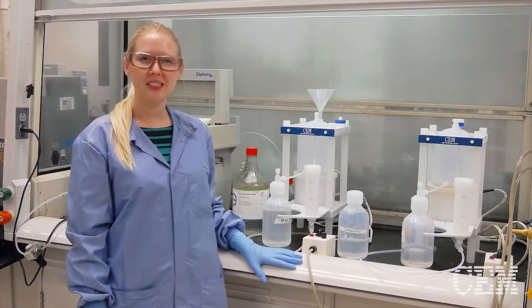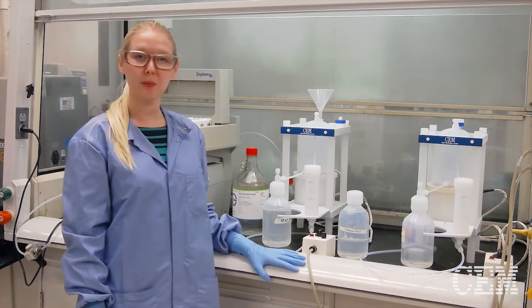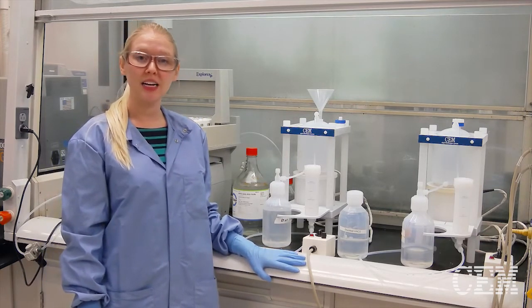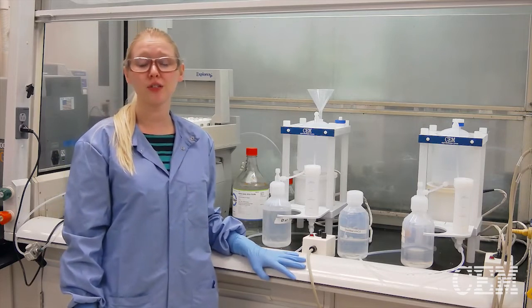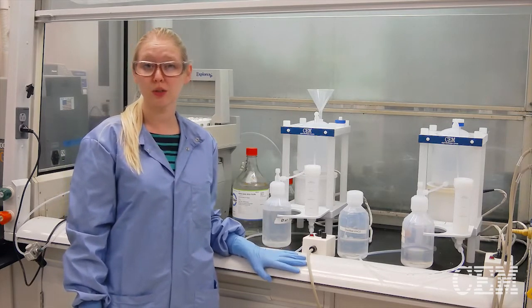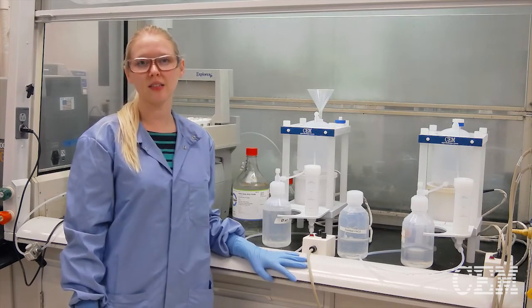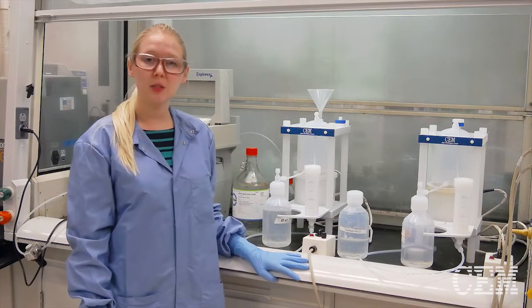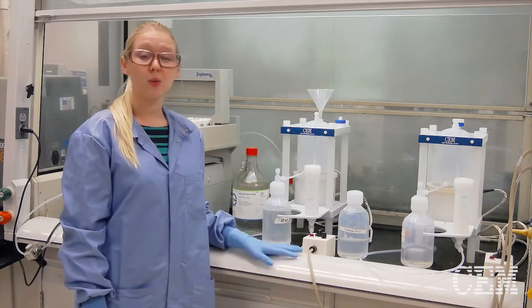Hi everyone, I'm Macy with CEM's analytical applications group. When you're doing elemental analysis, whether it's ICP-MS or OES, you want to make sure that you're using ultrapure acid. This is going to help you reduce background interferences for certain analytes. One way that we do that here at CEM is by using the acid purification system that we sell.